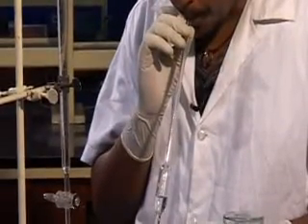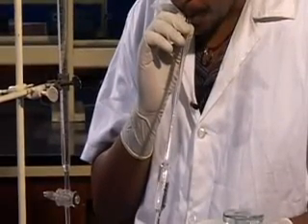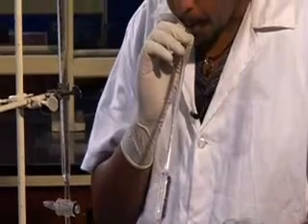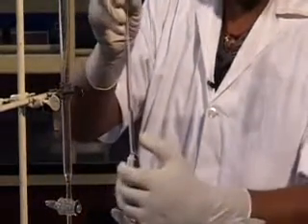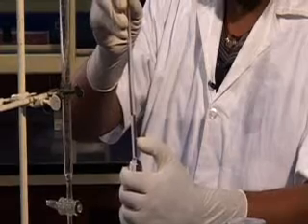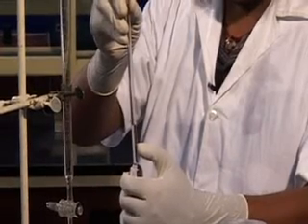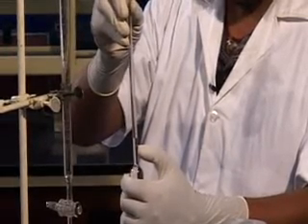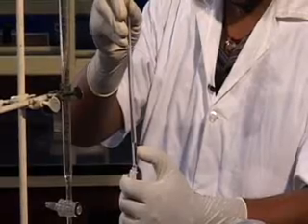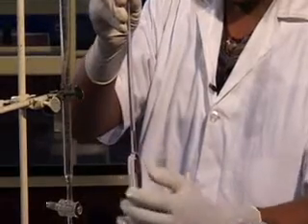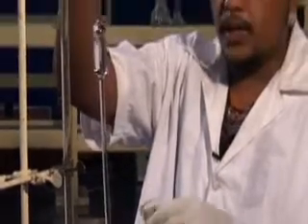This is the 20 ml mark. I am going to adjust up to the 20 ml mark. Now it is 20 ml. I am going to transfer to the conical flask now.